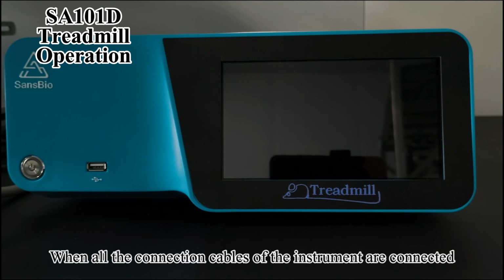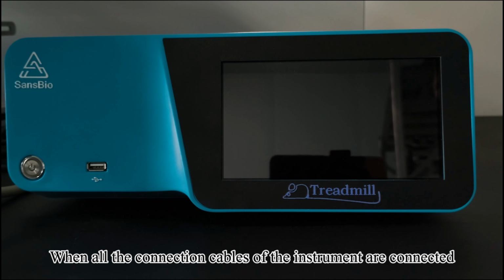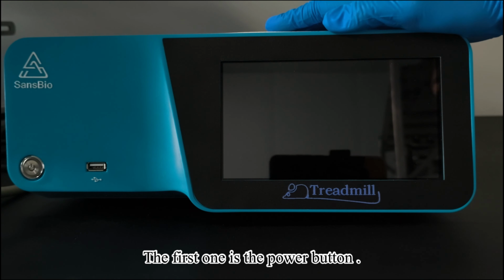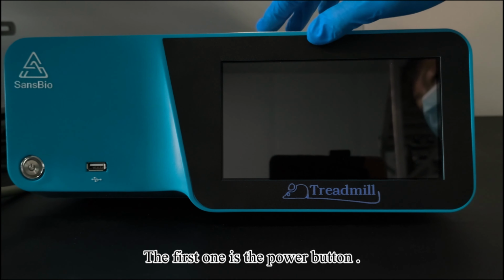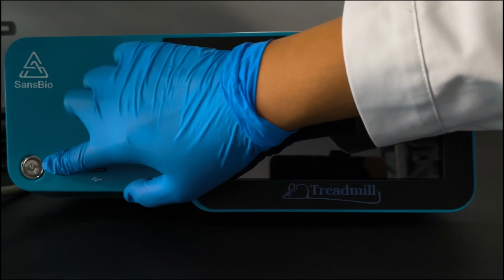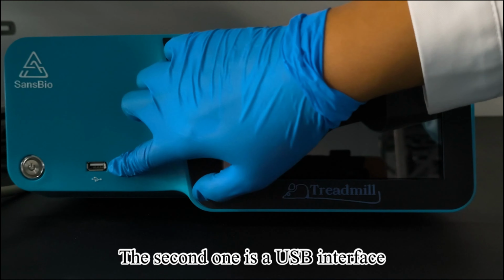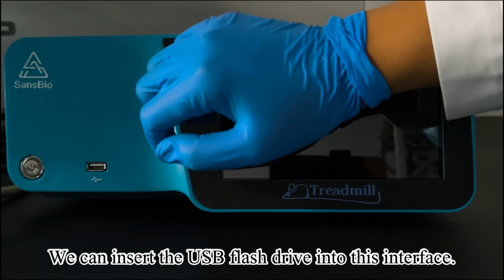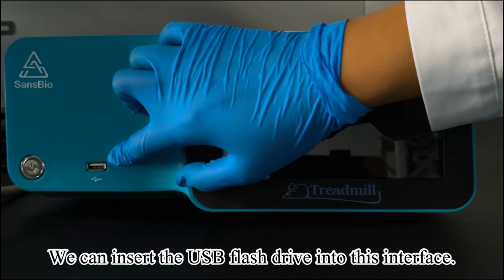When all the connection cables of the instrument are connected, we start to prepare to use the controller, which is the mainframe. The first one is the power button, which can be used to turn the device on or off. The second one is a USB interface, which is mainly used for exporting data. We can insert the USB flash drive into this interface.